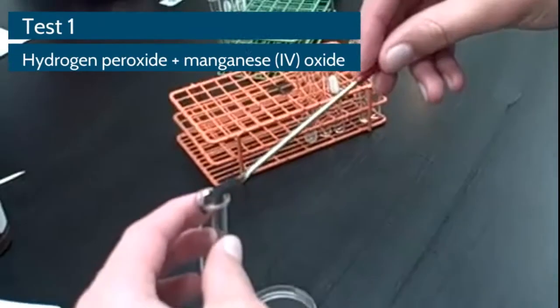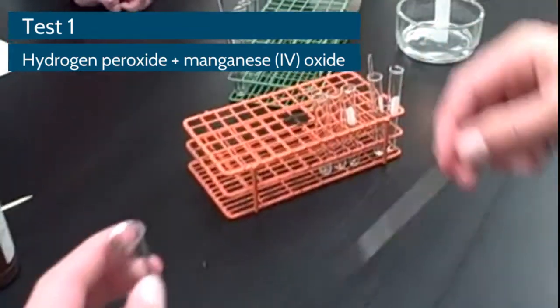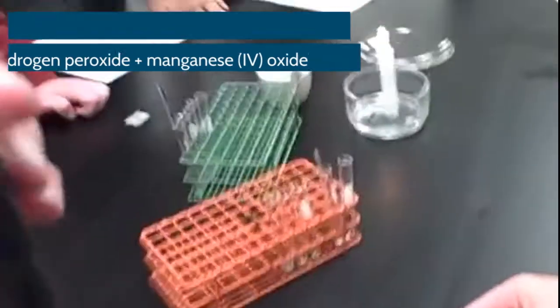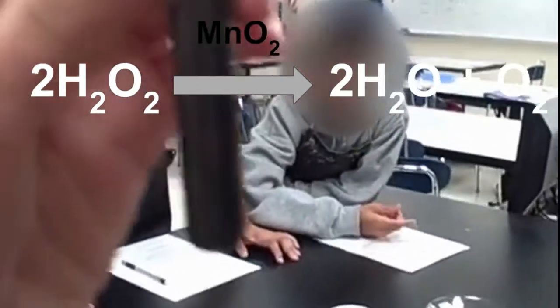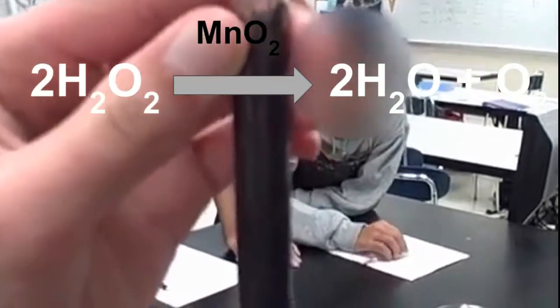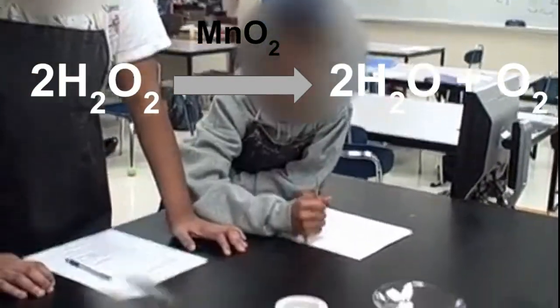Okay, Andrew, go ahead and add the manganese dioxide to the tube with hydrogen peroxide already in and just lift it up so we can take a look and see what's happening. Okay, what do you see? What's taking place? Bubbling. Okay, we can definitely see that there's bubbling taking place in the tube. We even see that there's oxygen, I think, coming out of the top.